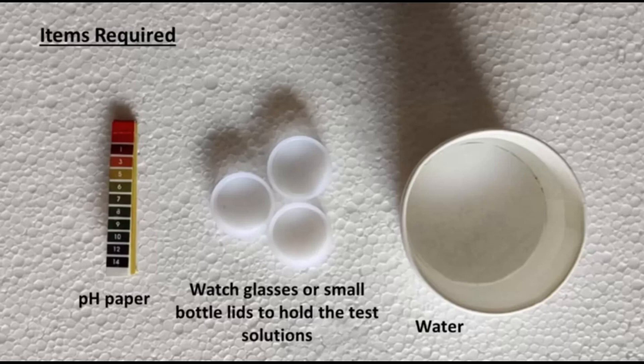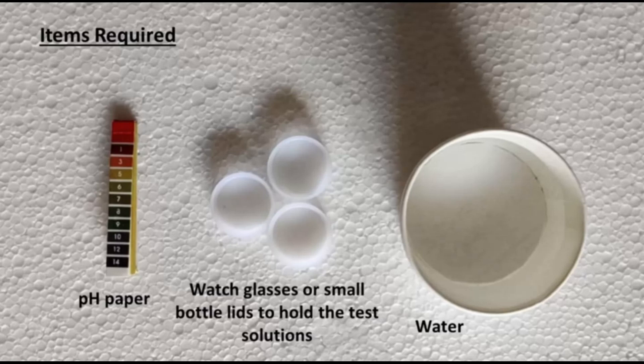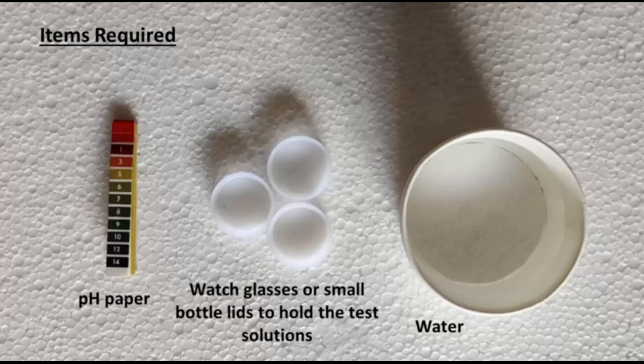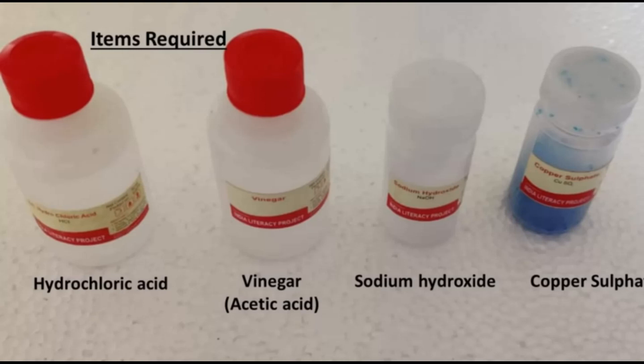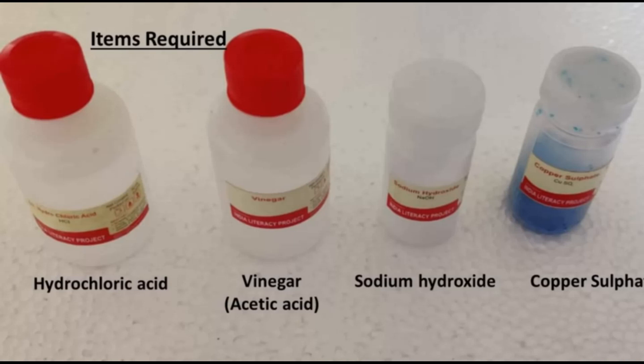For this, we require pH papers and watch glasses or small bottle lids to hold the test solutions. We also need to take some water — it is better to take distilled water because distilled water is neutral. Here, we are going to take hydrochloric acid, vinegar (that is acetic acid), sodium hydroxide (that is NaOH), and copper sulfate (CuSO4).